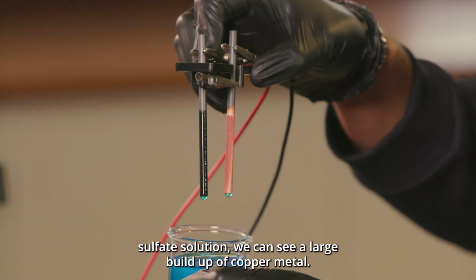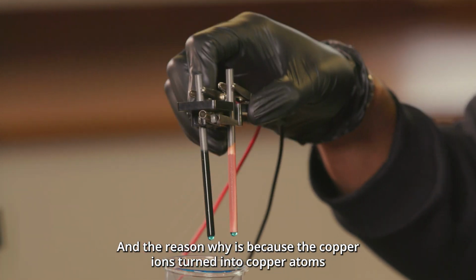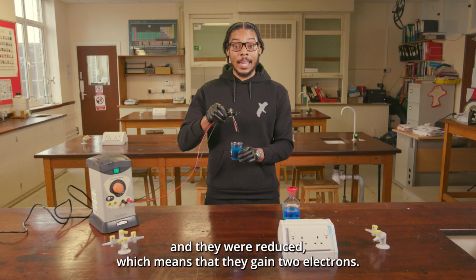Right, now when we take the carbon electrodes out of the copper sulfate solution, we can see a large buildup of copper metal. And the reason why is because the copper ions turned into copper atoms and they were reduced, which means that they gain 2 electrons.